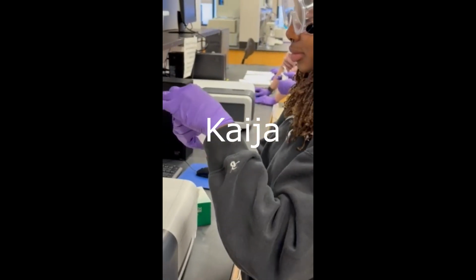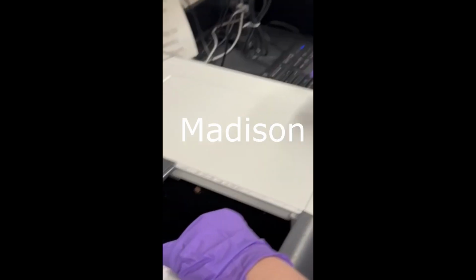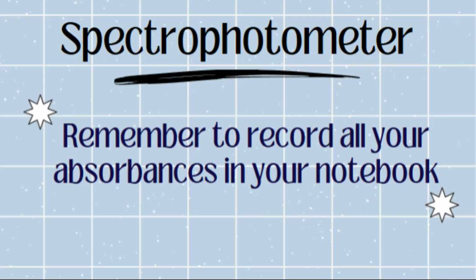Now we are going to perform the experiment again. Wipe the cuvette with a wipe to make sure that nothing remains on the outside of the cuvette. Open the lid to the spectrophotometer, place the cuvette in, close the lid, and press run. Repeat this for all the other cuvettes. Always make sure you record your absorbances after they are measured on the spectrophotometer.